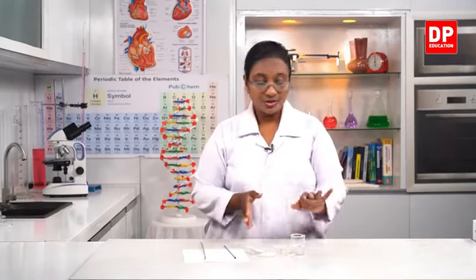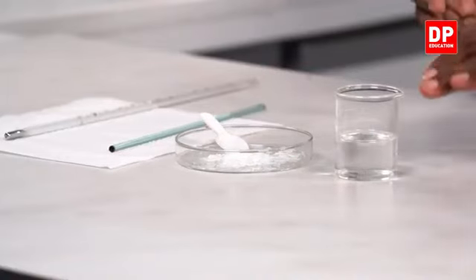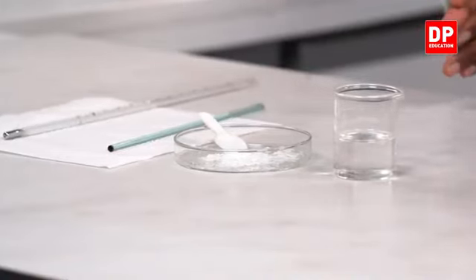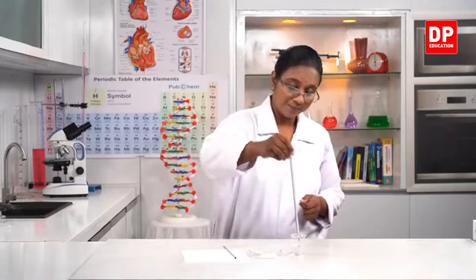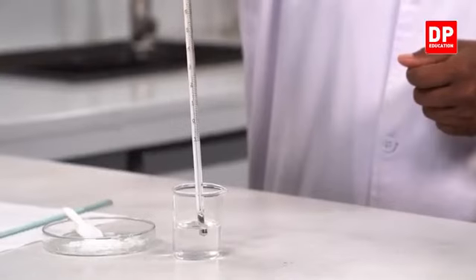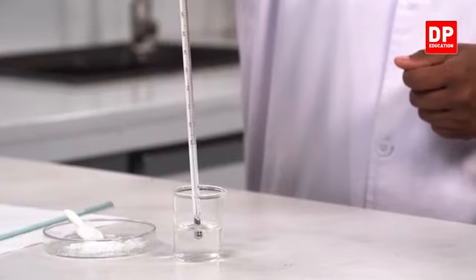So now the next activity, we will observe the change that takes place when I add a few pellets of sodium hydroxide into sulfuric acid. So here I have the sulfuric acid and these are the sodium hydroxide pellets. So this is a liquid state substance, a solution, and this is a solid state substance. So what we need to do is initially we need to take the temperature reading of the sulfuric acid solution. So that will be the initial temperature. It should not touch the wall or the bottom of the beaker. It has to be completely in the solution, that you all know.